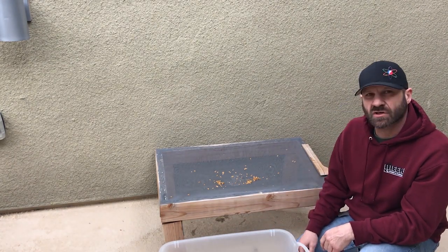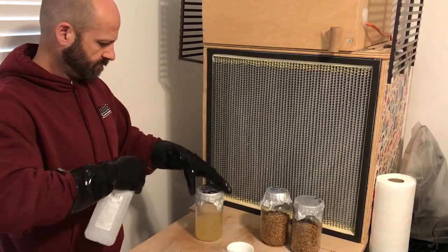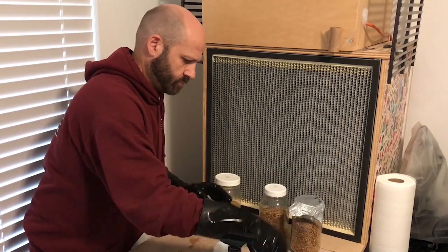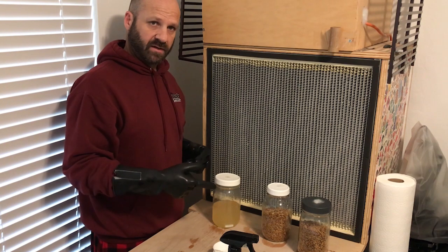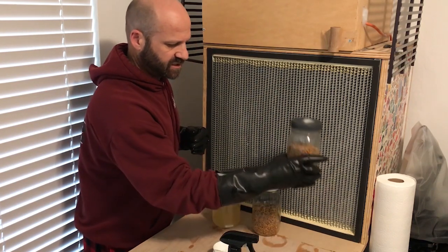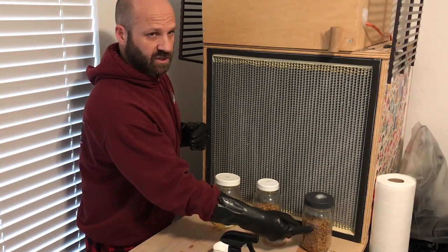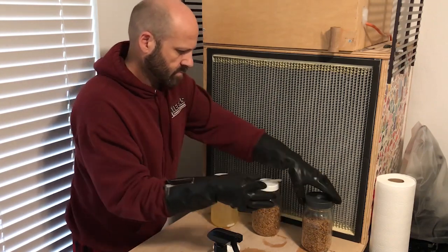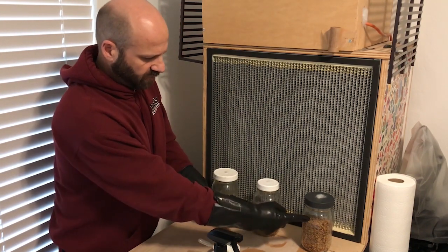I was expecting about eight but it ended up being seven, so still an extra jar from the boil and soak method. We're going to put these through the pressure cooker, then inoculate and see how long it takes to colonize. The next day: this jar here is our boil and soak, this jar is just a soak - boil plus 12 hours versus 24 hours soaking in a bucket of water. I'll mark these so we know which is which - the smaller lid is the boil and soak, the larger lid is just the soak.